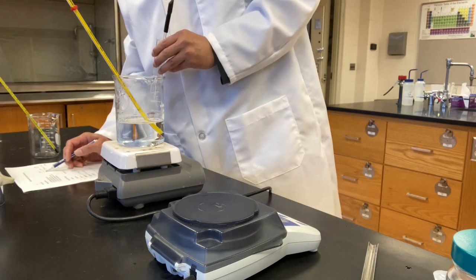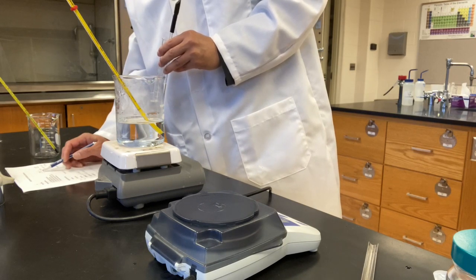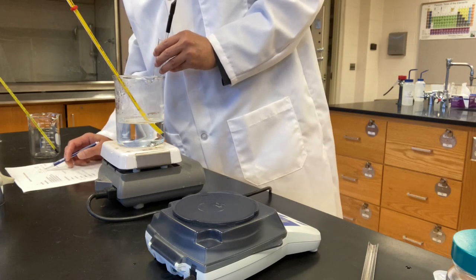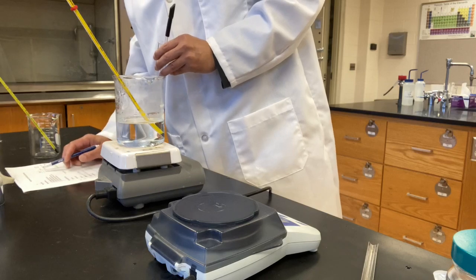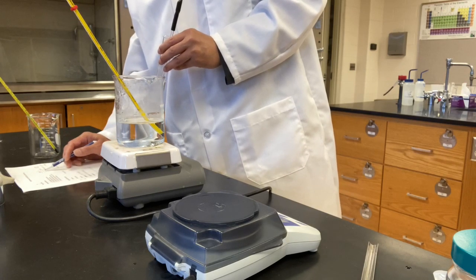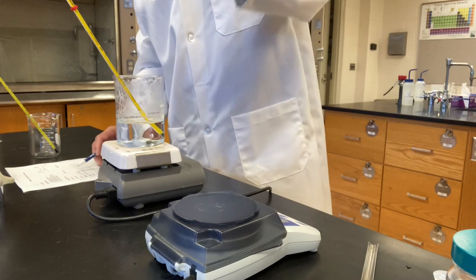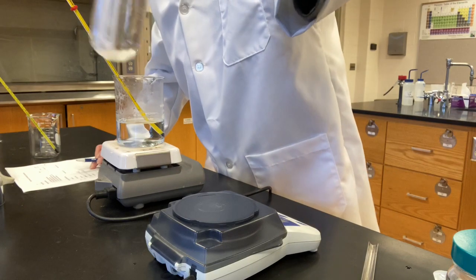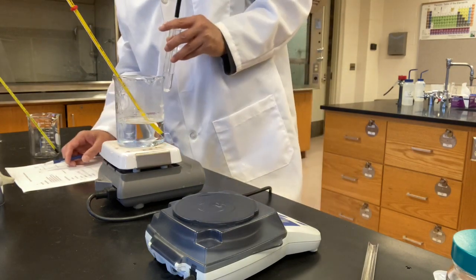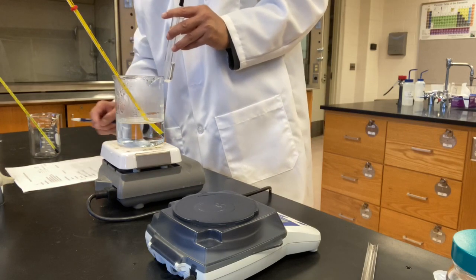Okay, line number 2 is the total amount added at 22 degrees Celsius, and line number 3 is the additional amount of potassium nitrate added at 50 degrees Celsius. Now the total mass of potassium nitrate in the test tube is the sum of line 2 and line 3. You add them together and put it on line 4.